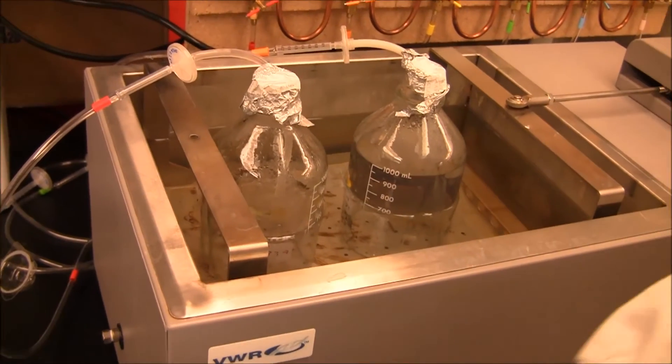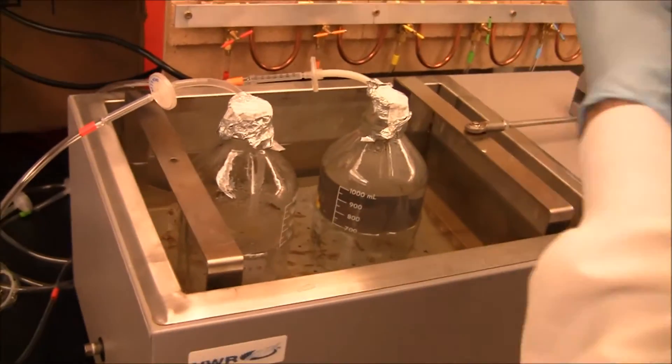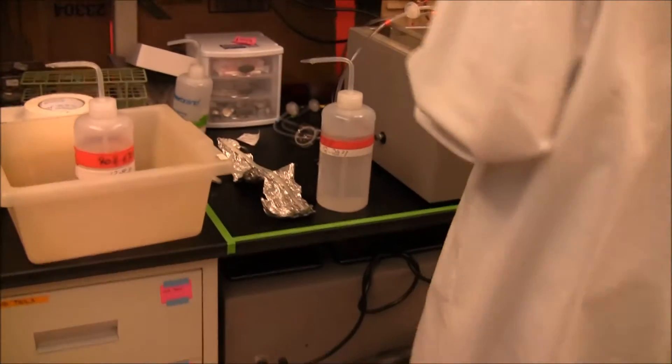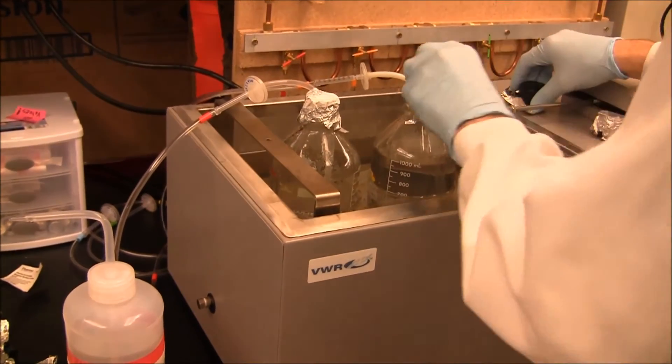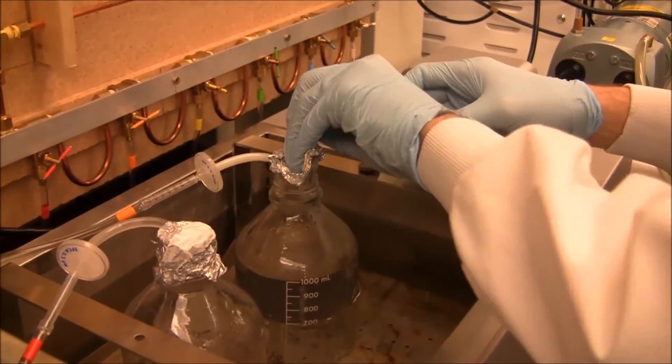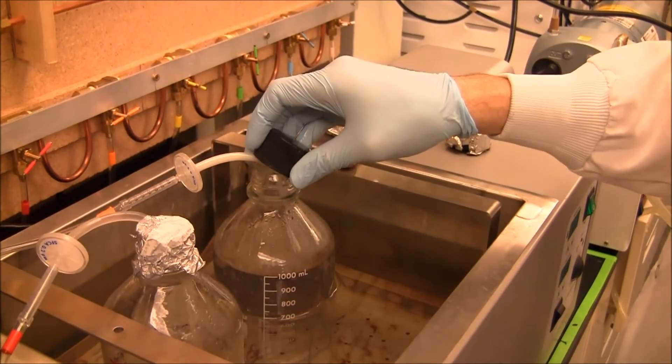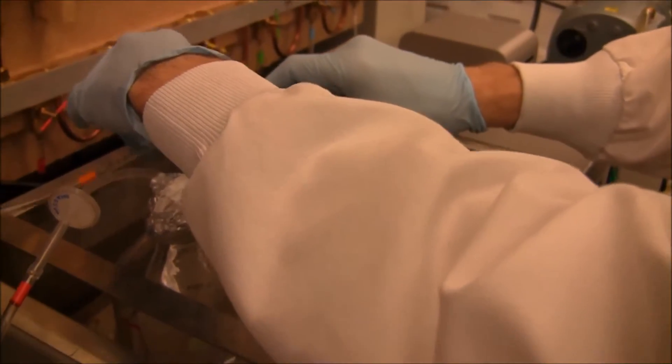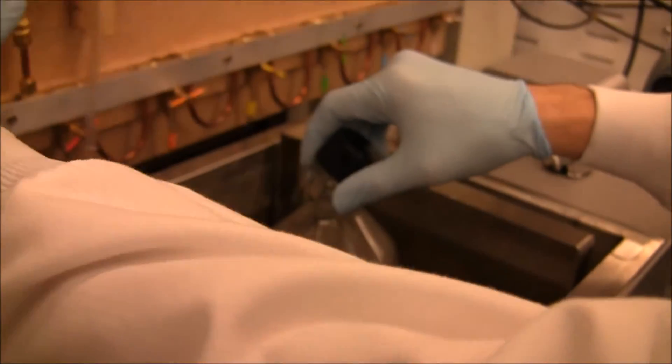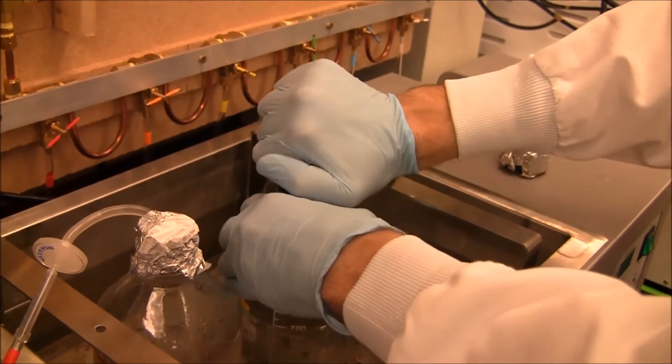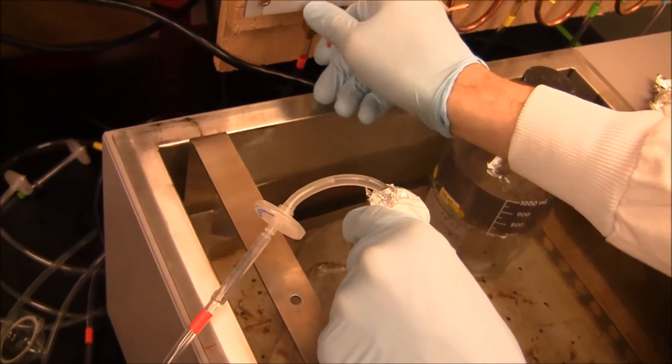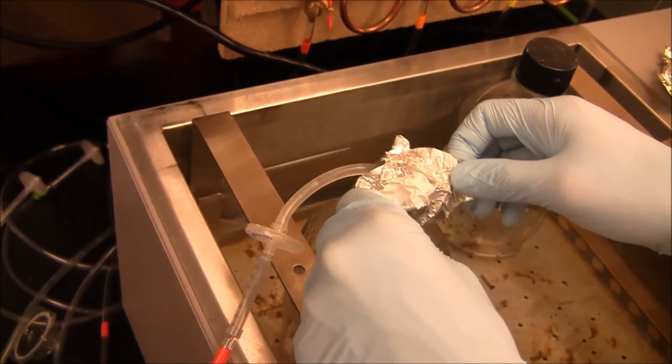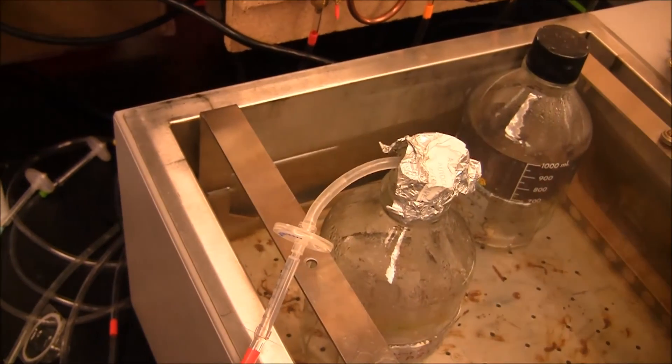Alright, so now, as in our previous video, I'm just going to sterilize my hands, find where I'll put those autoclave caps. And quickly replace the foil with the cap. Okay. Should I make that open? There you go.